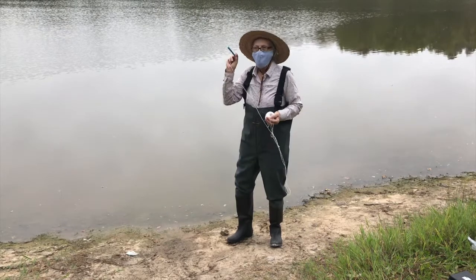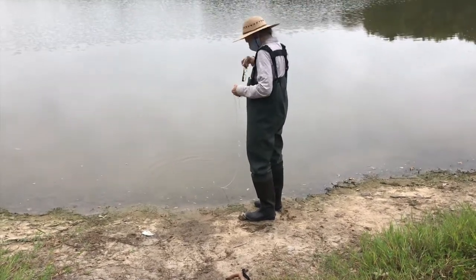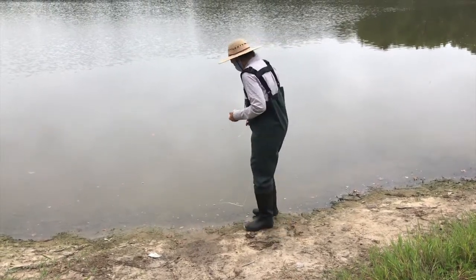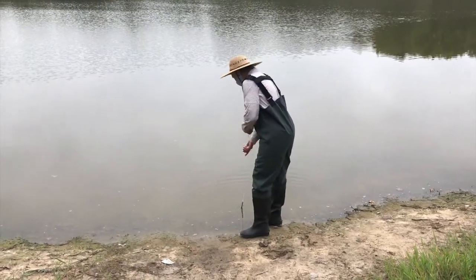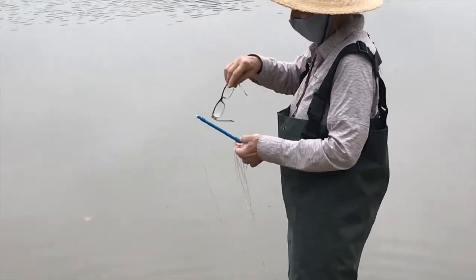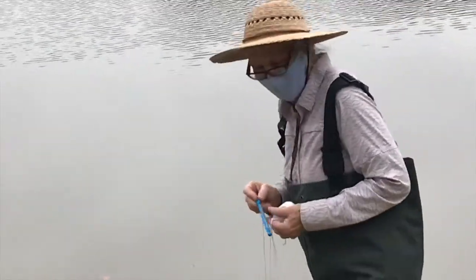So let's see what it is right here at the shore. Give it a little moment here. Do you think that's long enough? Yeah. Right here. It is the same as the air temperature. Surprise, surprise. Okay, now here we go.